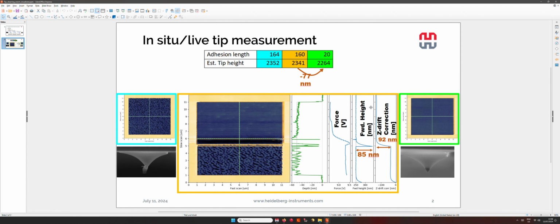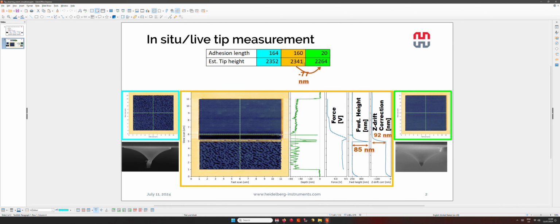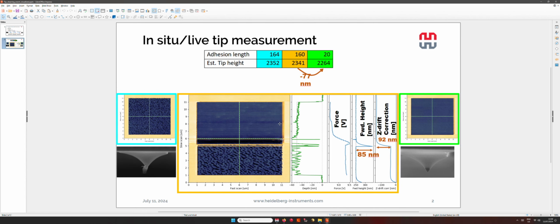And here I would like also to show you how this looks practically from the analysis whenever we are patterning and, for example, we have a cleaning event. So we can see that we start patterning with the first approach, and we have these specific values of adhesion length. Then at some point, we have a cleaning event where we lose 77 nanometers in estimated tip height. So we get rid of this material that was accumulated on the tip. So the tip height decreases, but by cleaning the tip, we also observe that the adhesion length is drastically reduced, because you see that this accumulation of materials also increases the diameter of the tip at its apex.